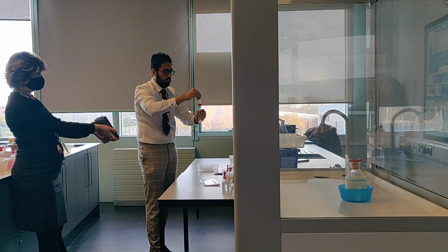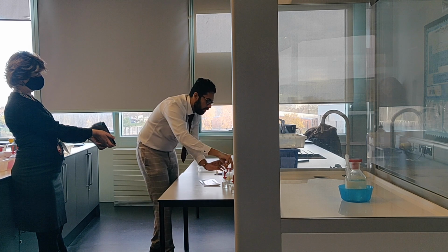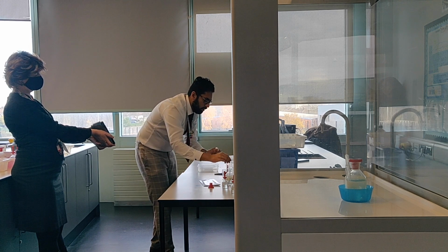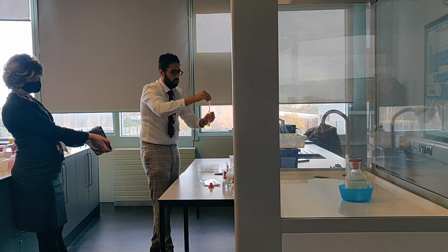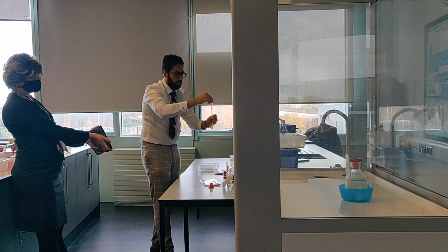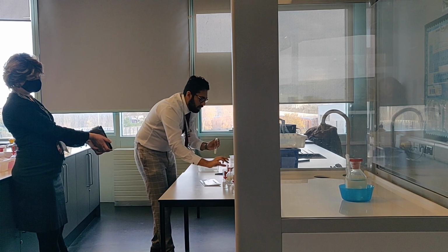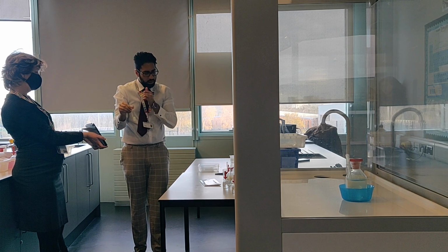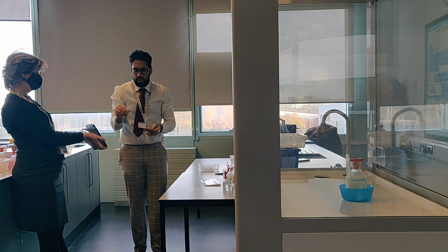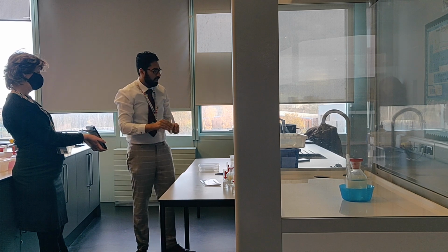So already that's become a green colour. Okay. Then I'm going to add the ammonia, which is the normal 2 molar ammonia. Okay, obviously you can see that a cream precipitate was formed, as you would expect with bromide. So with chloride it was white, bromide is cream, and obviously you know what it's going to do with iodide, but we're going to do it anyway. And this again gets disposed of in the sink.